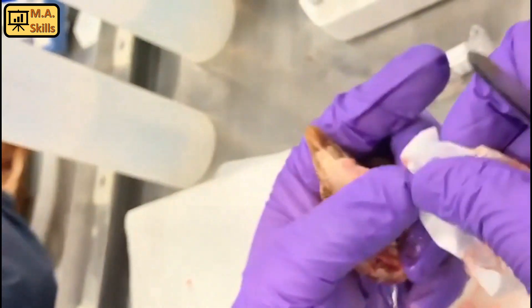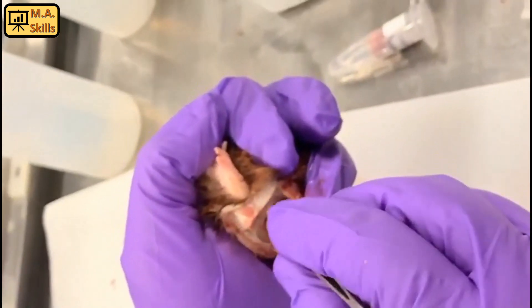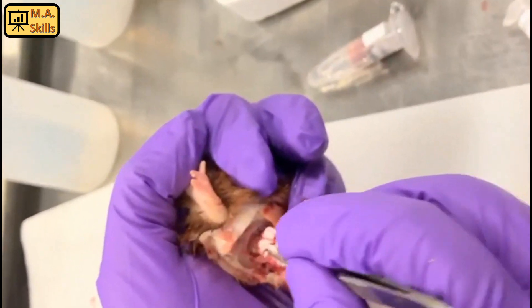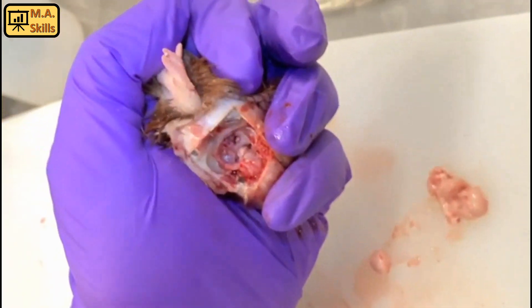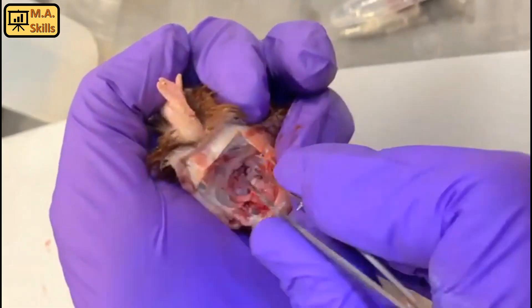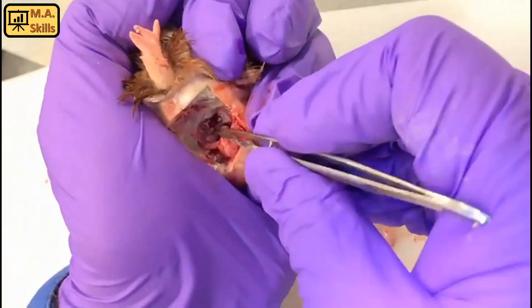We need to cut the bone and clean the flap over there. Here we can see the pituitary, but what I'm going to do is just cut the tissue around it.